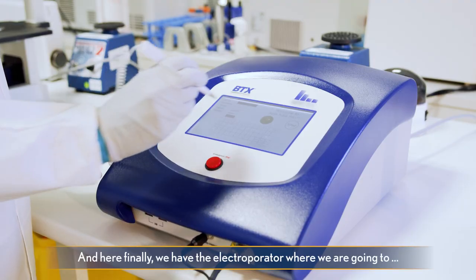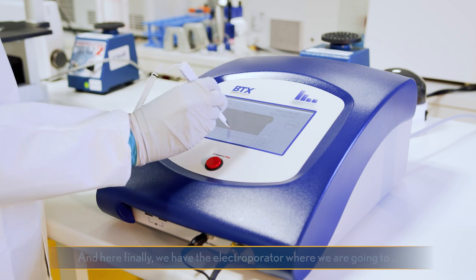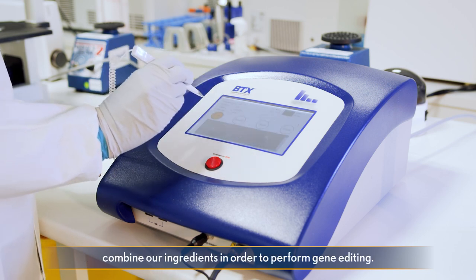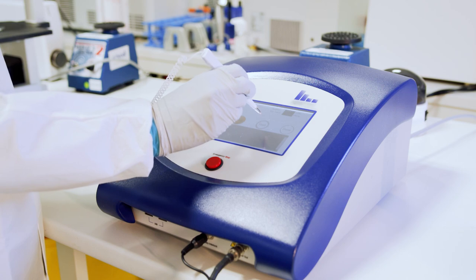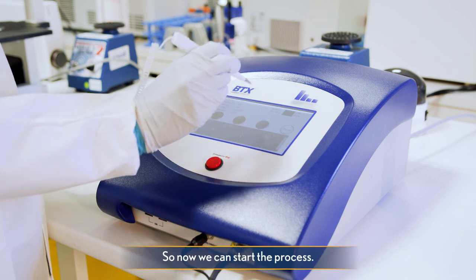And here, finally, we have the electroporator, where we are going to combine our ingredients in order to perform gene editing. So now we can start the process.